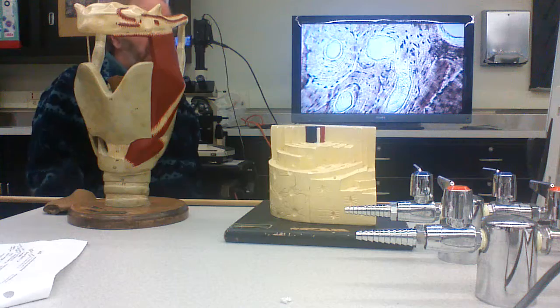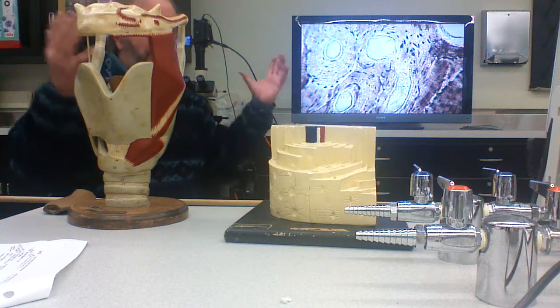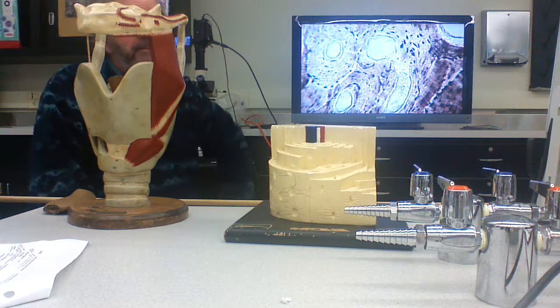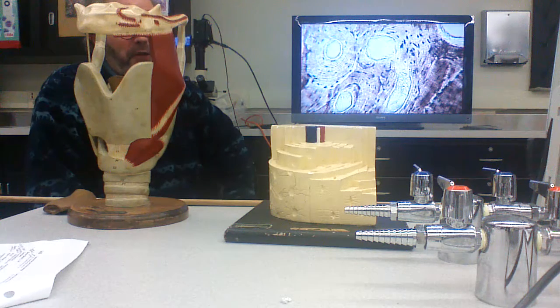They were cells that made the compact bone. They've now become quiescent because they can't build any more bone. But if you injure the bone or break the bone, those cells become active again, and the bone will start to reform. How are the osteogenic cells different than osteoblasts? Well, osteogenic cells develop into osteoblasts.